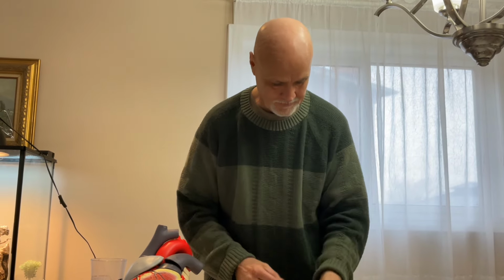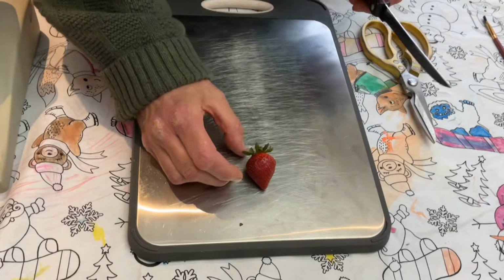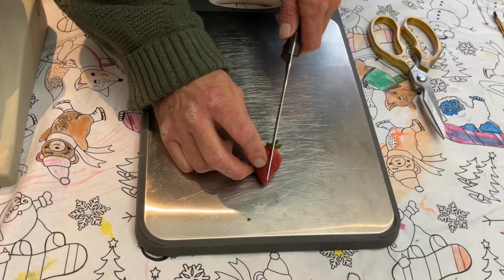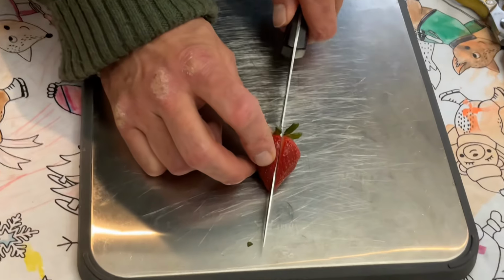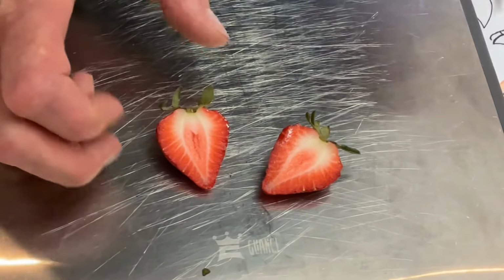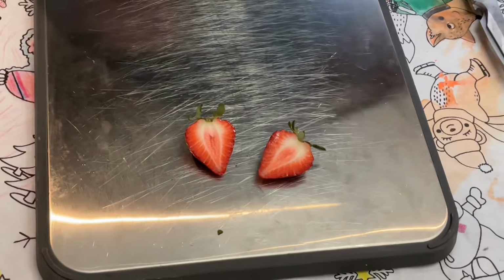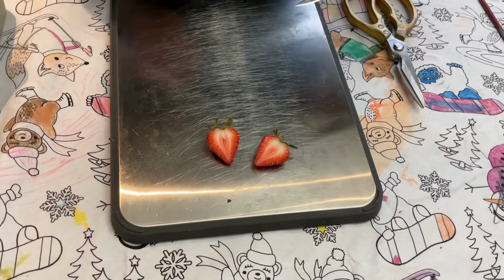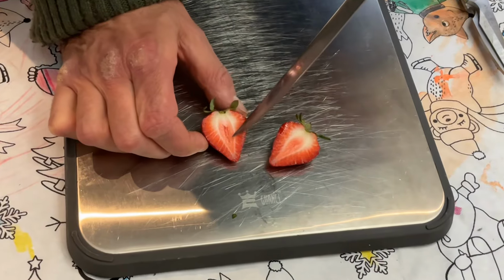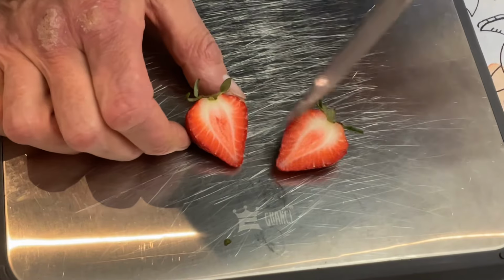Let's look inside of our heartberry. So as you can see with our heartberry here, I'm going to cut it open. And what do we find inside of it? Hopefully, oh, we do have it a little bit. We have chambers, which is French for rooms, chambre. So we have little chambers inside. We have 1, 2.